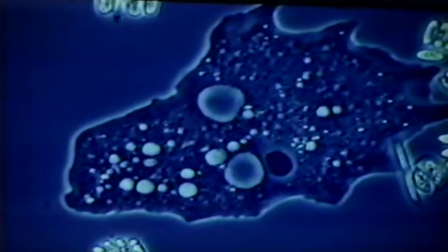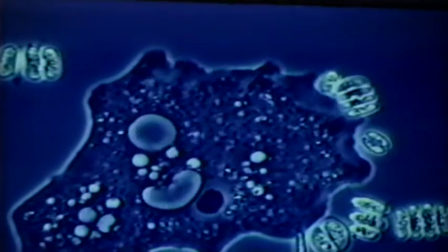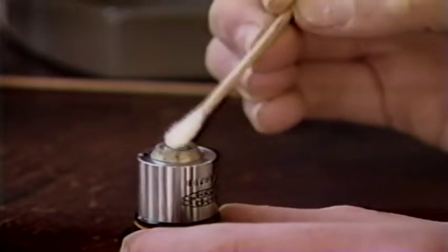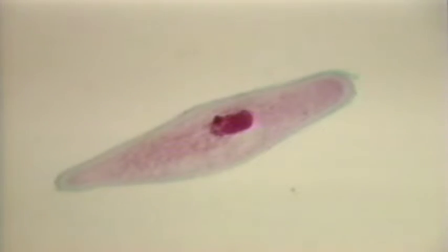In order to get good results from your microscope, several factors are necessary. First, the samples must be thin enough to easily allow light to pass through. Second, optimum light must be provided for good illumination. Third, the sample must have contrasting elements of dark and light. For this reason, staining is often used to accentuate the features. In addition, the lenses must be clean, and the focus must be sharp. In the beginning, it is convenient to work with prepared or stained slides in order to become familiar with the workings of the microscope.